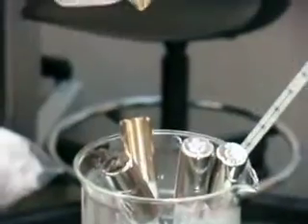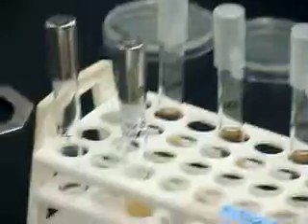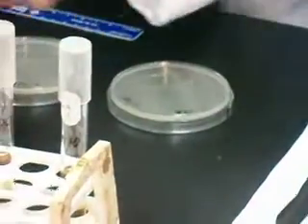And then we also have 5 soft agar tubes, which I have boiled and cooled to 50 degrees. And then we have all the plates, TSA plates labeled with the dilution factor, and ready to start the experiment. So the first thing you should do is the dilution series. So I will demonstrate how to do that.